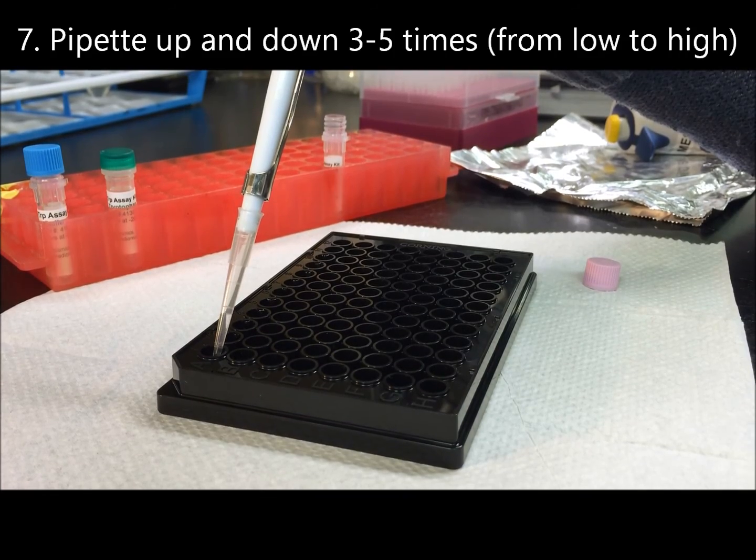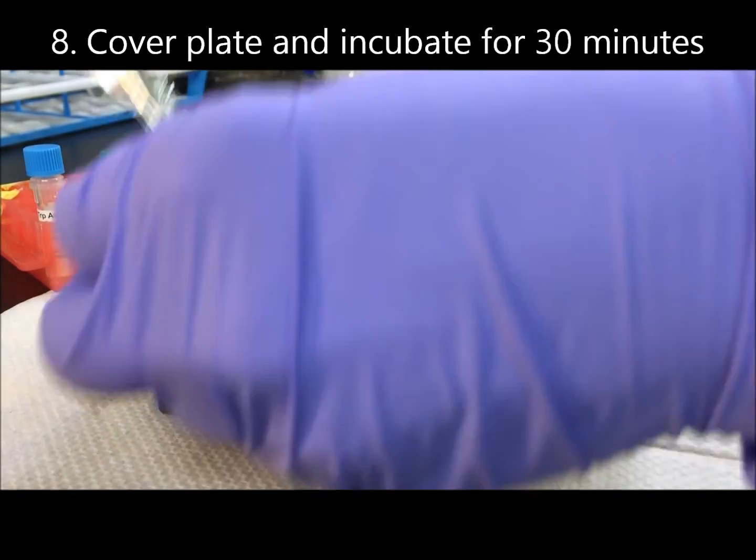When you are finished mixing, cover the plate with aluminum foil and incubate for 30 minutes.